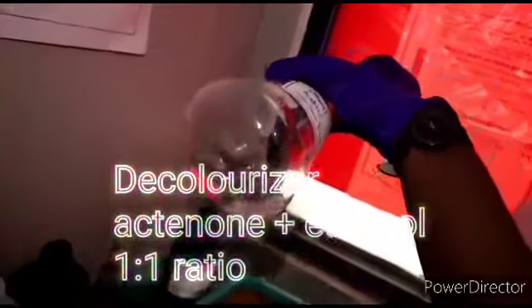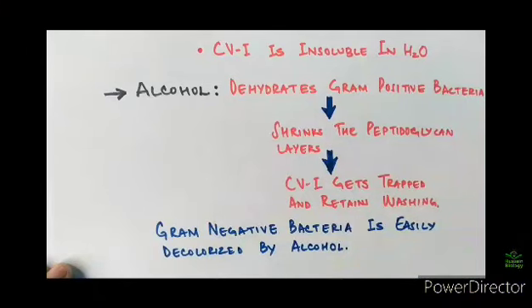In the next step, the decolorizer is added to the slide in drops until the movement of stain is observed. After that, there should be an immediate water wash of the slide. The decolorizer shrinks the Gram-positive cell wall, while the stain is removed from the Gram-negative organisms.